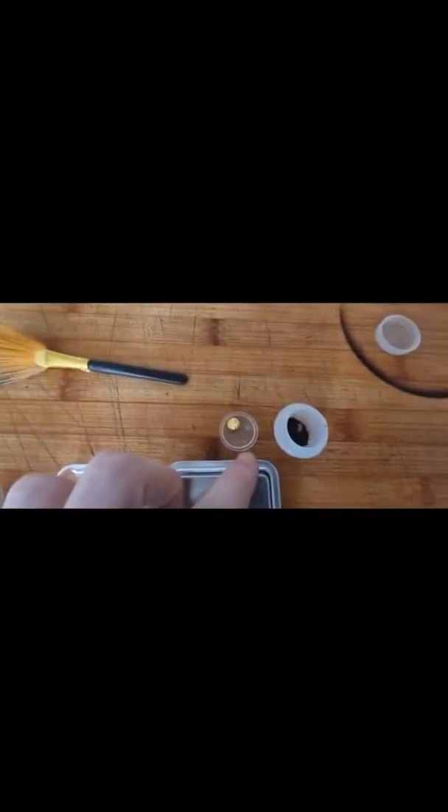So I gave it a wash. This is what we're left with — we're finished drying, still a little bit wet. Then I'll weigh it up and see what we've got. So we're just weighing it all up now. That's what it looks like after it's melted. That's what the powder looks like. This is what we've got — it's a nice powder.